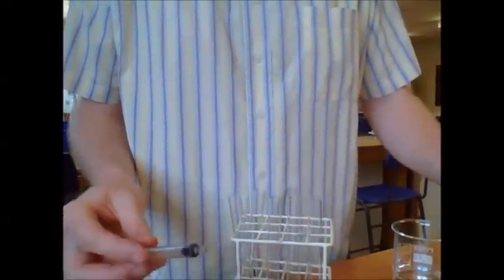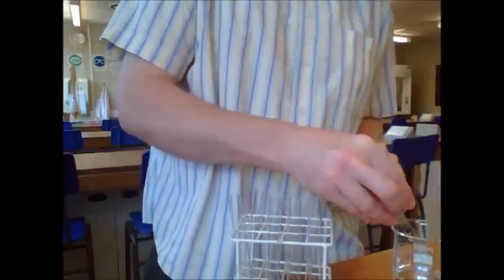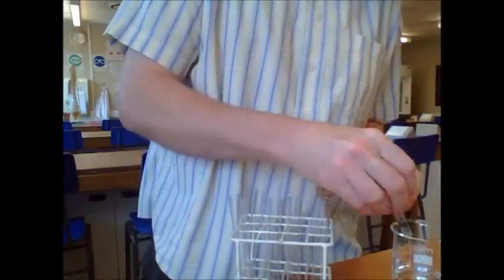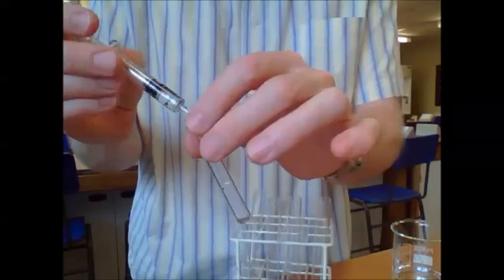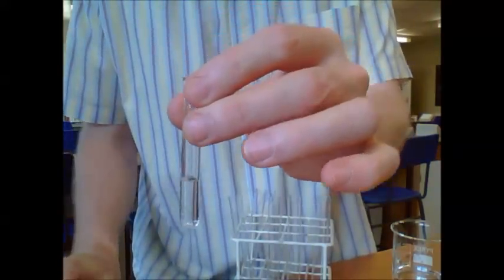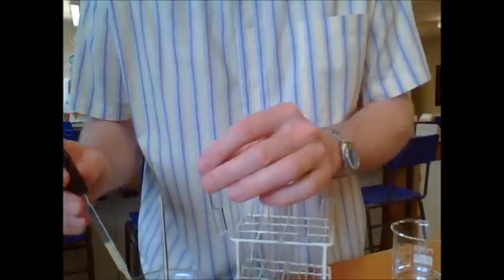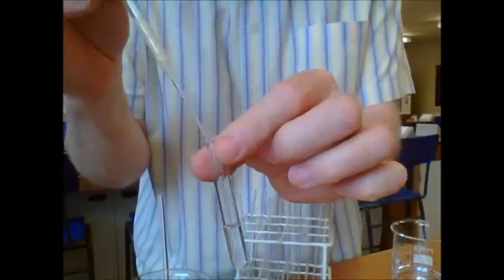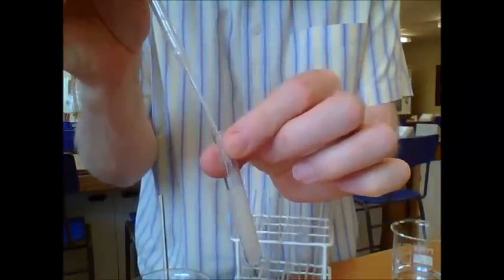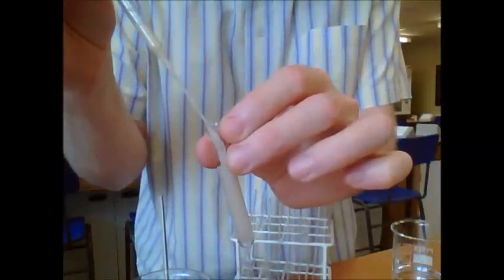The first thing to do is prepare one cubic centimeter of sucrose solution into each of five small tubes. Then we need to fill up the small tube with the yeast suspension. We're going to fill it right to the top.